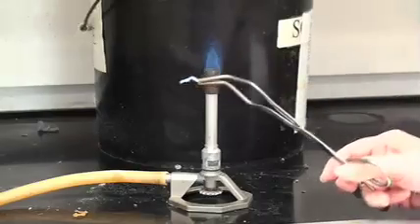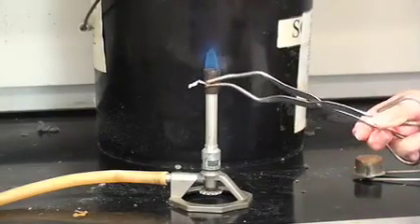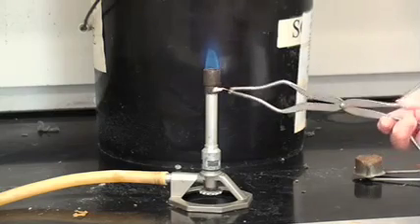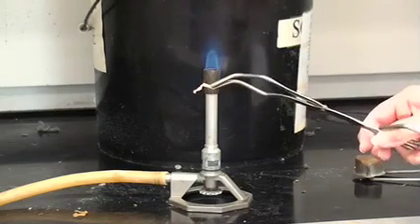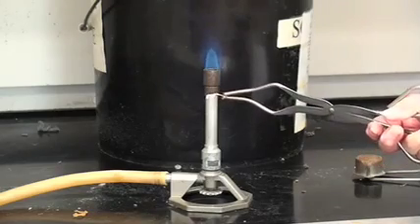One of the things that's important to look at is what do the products look like? You will notice that the magnesium now has this bright white coating and that is in fact the magnesium oxide that we have generated on this piece of magnesium.